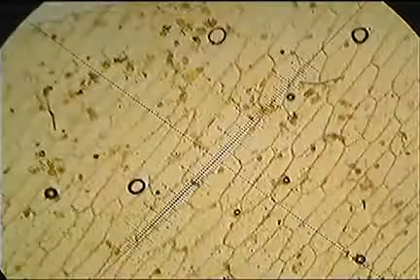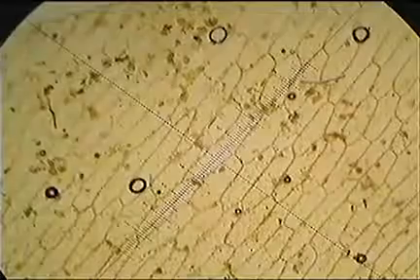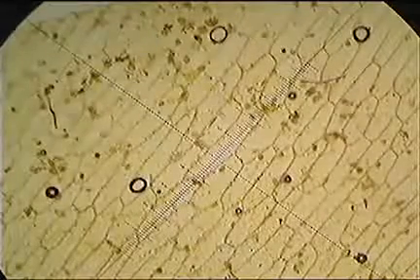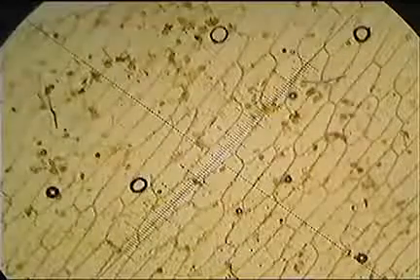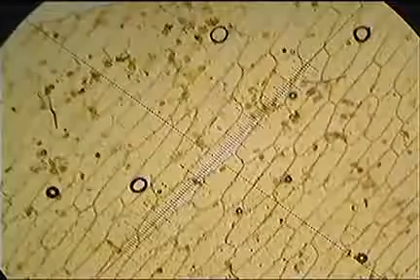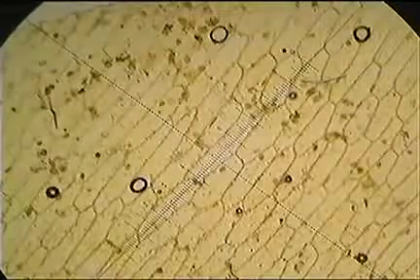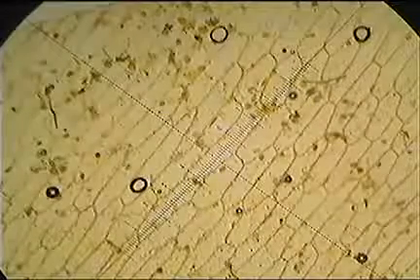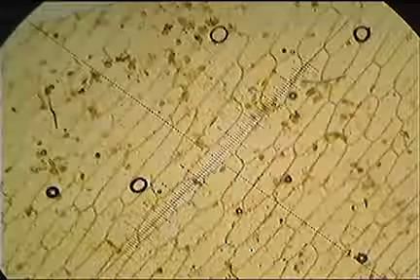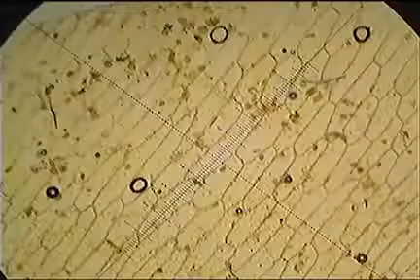So just moving it to look at another cell now. Looking at the cell just to the left of the center underneath the scale, this one's only 2.5 units across. So we could take our value, 0.099, and multiply that by 2.5 eyepiece graticule units, and that would give us, rounded, 0.25 millimeters across.